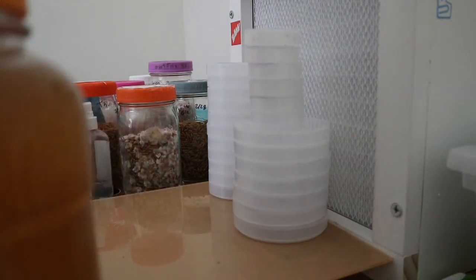So from here, I'm gonna fast-forward it, and just between me and you guys, I'm a pretty good, I'm a fast pourer. I got the fastest pour in the West. No, I'm just kidding about that one. I'll pour up right now for you guys.